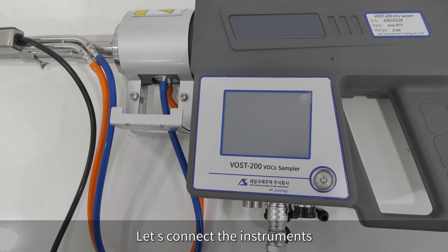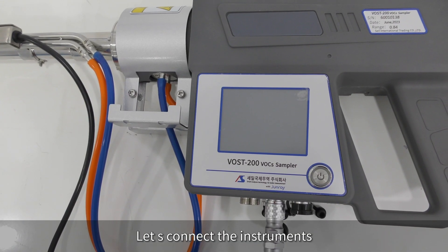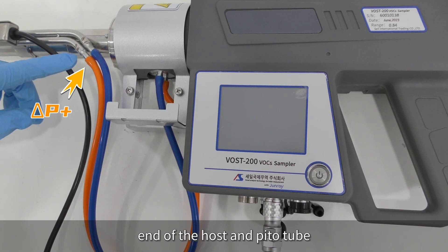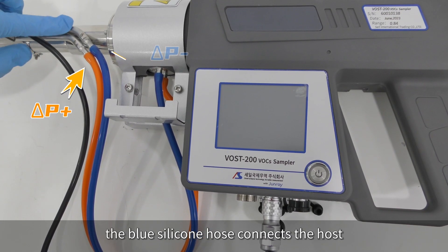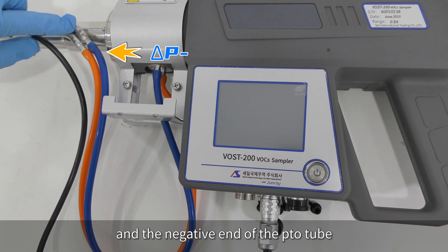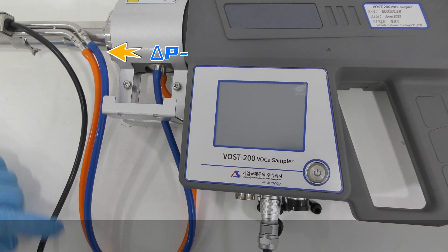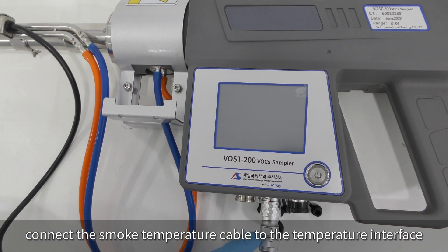Let's connect the instruments. The orange silicone hose is connected to the positive end of the host and pitot tube. The blue silicone hose connects the host and the negative end of the pitot tube. Connect the smoke temperature cable to the smoke temperature interface.